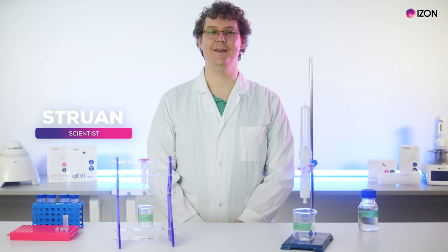Hi, my name is Struan and I'm a scientist at Izon Science, and today we'll be going through manually running a QEV column.